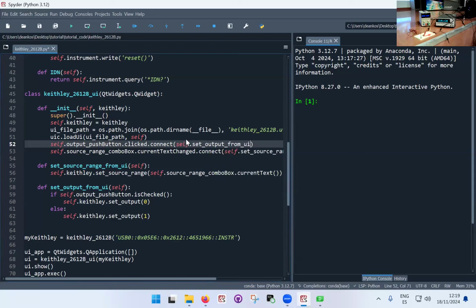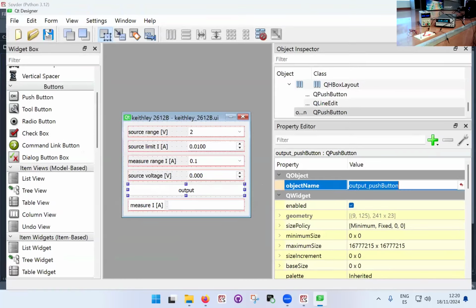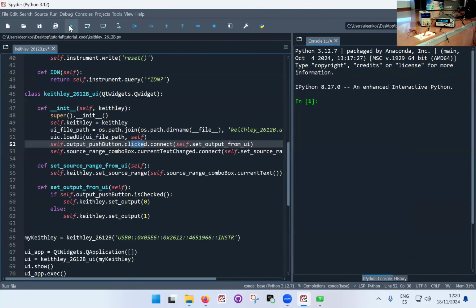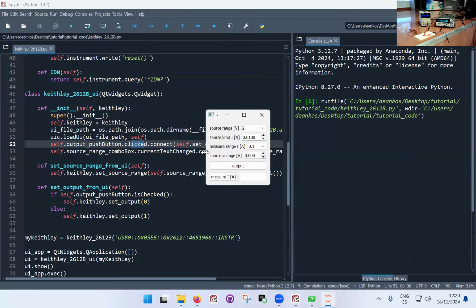from UI. Okay, so now with the buttons it's a bit more obvious because I click the button and it's obvious that clicked is the action that triggers the execution of this function. Okay, so I'm going to save this. It's important that you make sure that you saved all the UI files. So I'm going to execute this, and in principle my interface pops up same as before. And now let's see if it works.